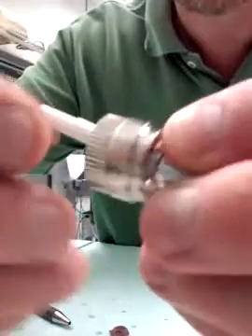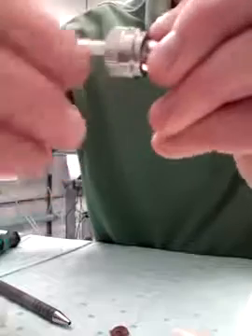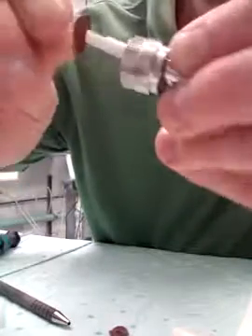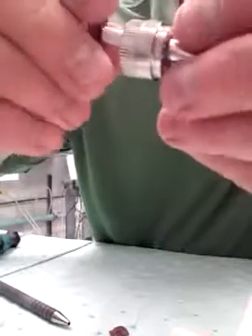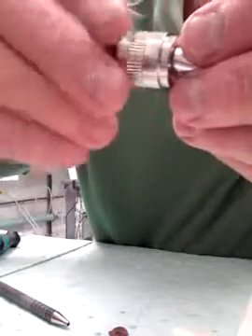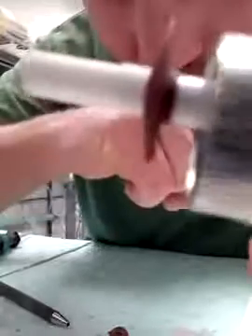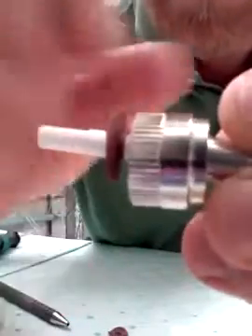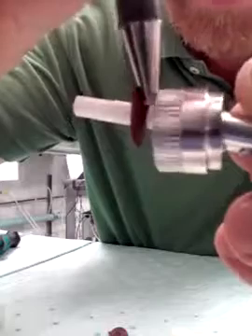If you just shove it over harshly, you're going to rip the inner diameter of the seal. With some twisting motion you can get it over the top of the shaft and still keep that lip oriented towards the back half of the shaft. The lip should be pointed towards the back half of the shaft. If you can take a magnifying glass and check that there are no rips or tears on the inner portion of the lip, that would be beneficial.